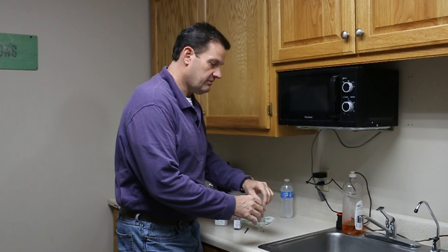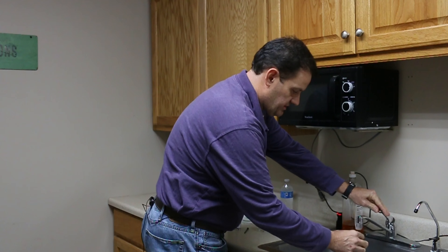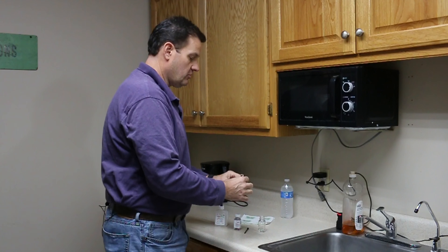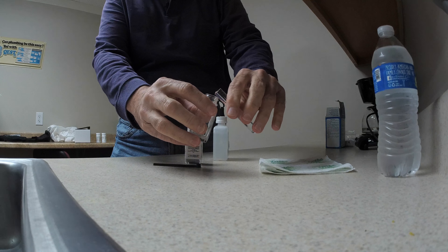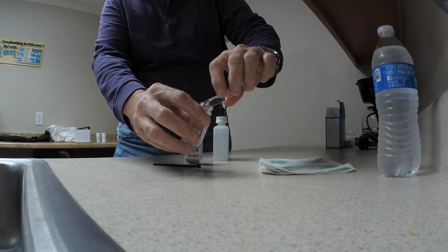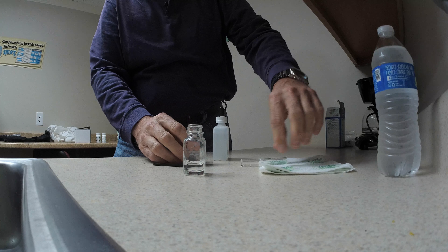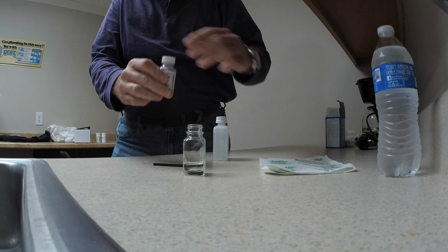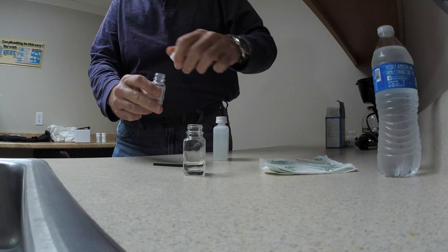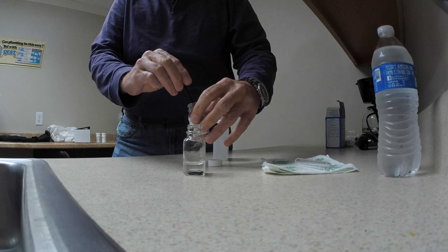So we're going to grab our first sample of the tap water. It doesn't take much — we just fill it in this little tube right here, and then we pour it into this glass jar. Inside the glass jar we're going to use this particular reagent, and what this does is if the water is hard it will turn pink. And we kind of anticipate it will, with it being tap water.